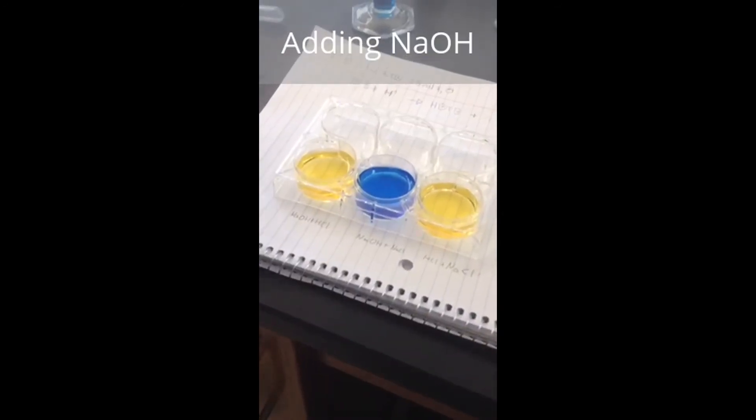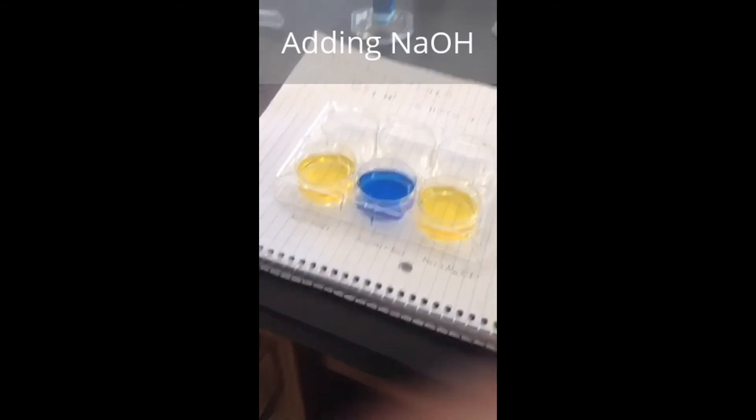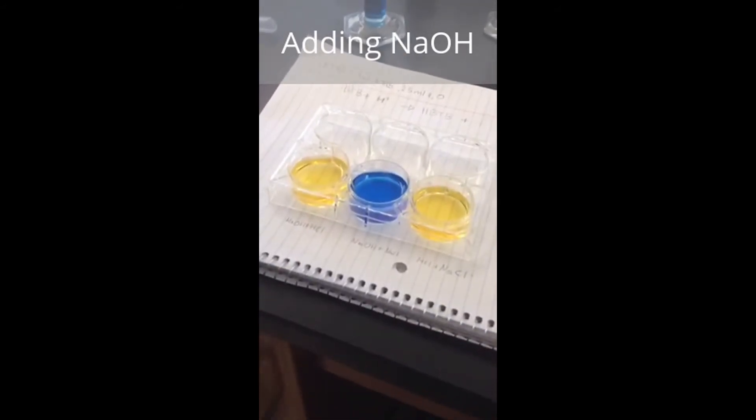Now we're adding more NaOH to see the effect of a change in concentration.